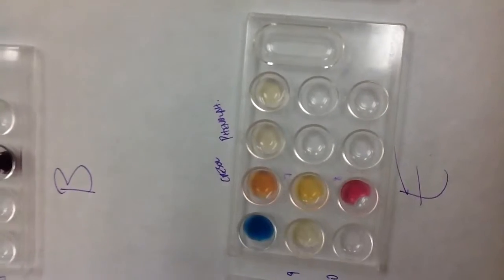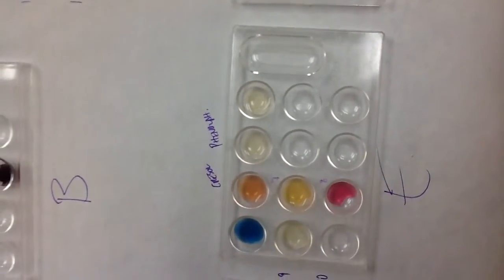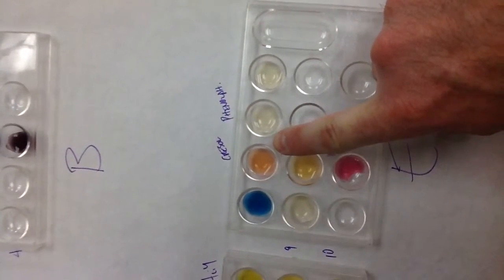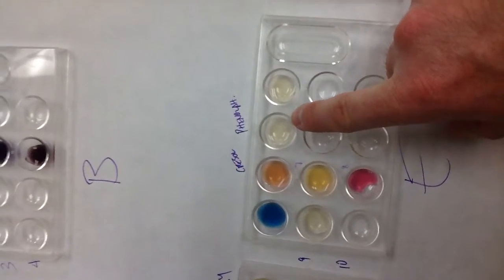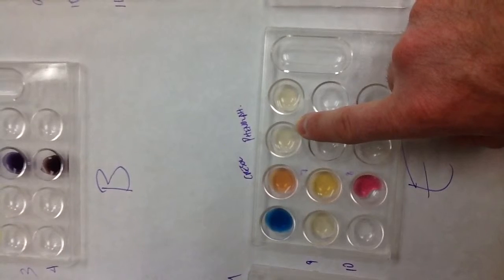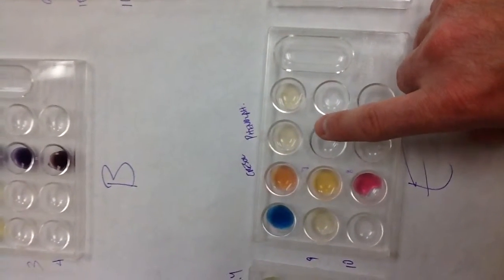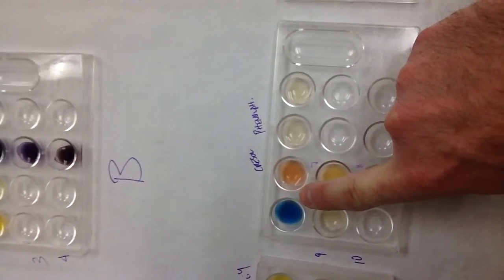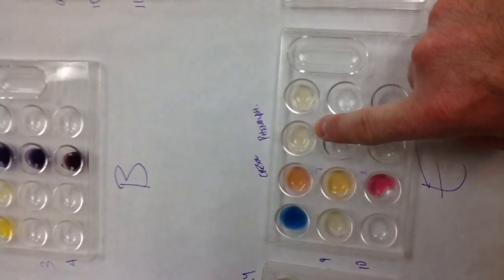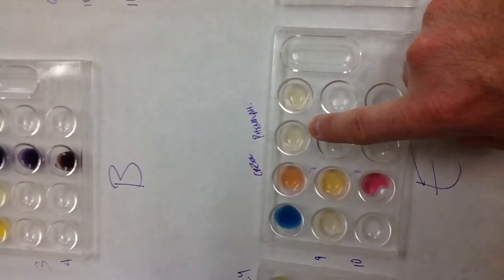Okay. Letter E, very similar, it turned blue. Then I went to cresol again and it gave me kind of a light orange here. Phenolphthalein I tested just because at pH 1 to 8 it's colorless. So I've kind of narrowed down: bromothymol blue gives me the range of 8 to 13, this range is 1 to 8, so where they overlap is at 8. And that gives me a lot of information.